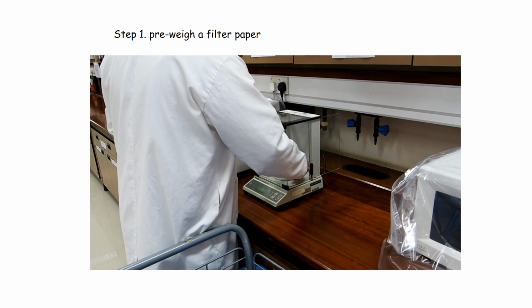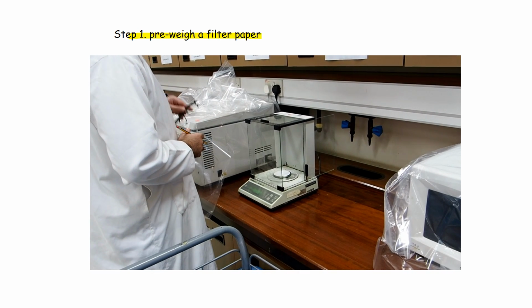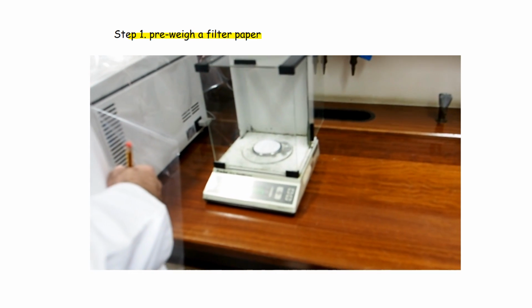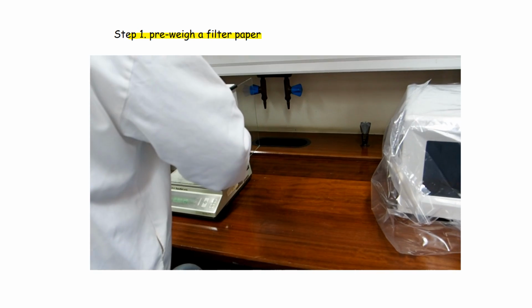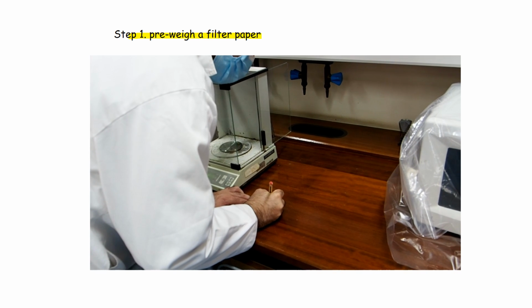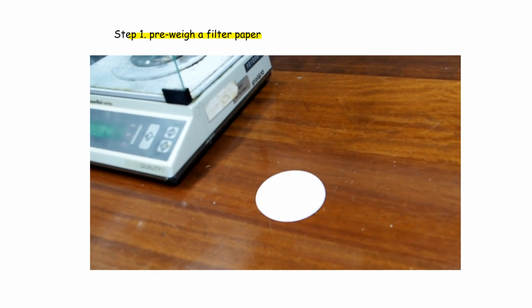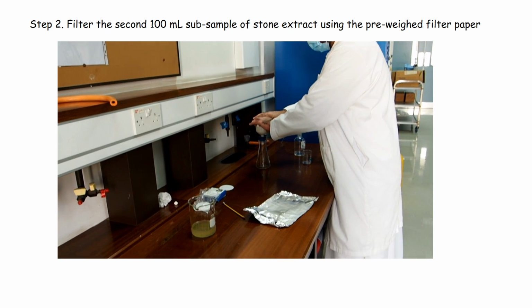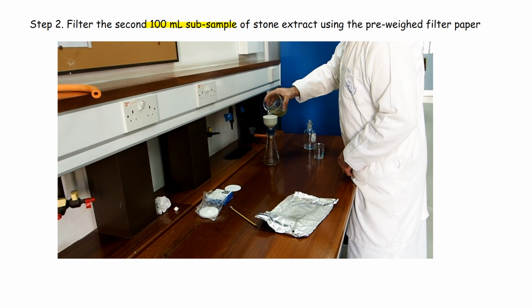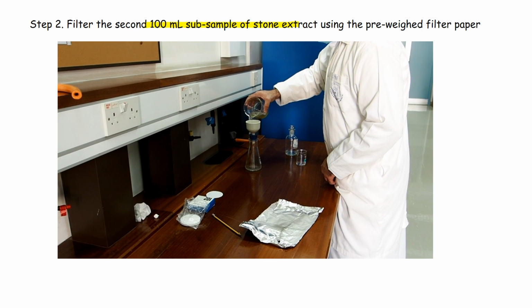So the first thing we need to do is to pre-weigh a filter paper and record its weight. We then take the second of our 100 ml subsamples that we made before, the stone extract, and filter it using our pre-weighed filter paper.